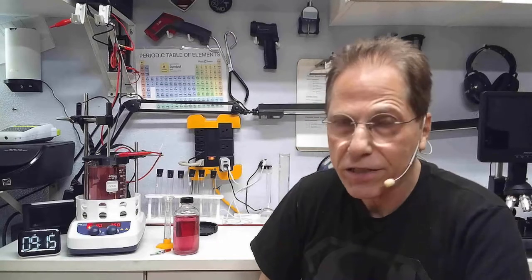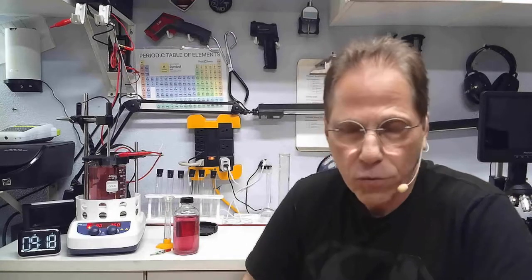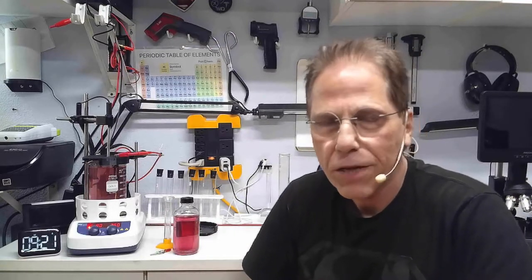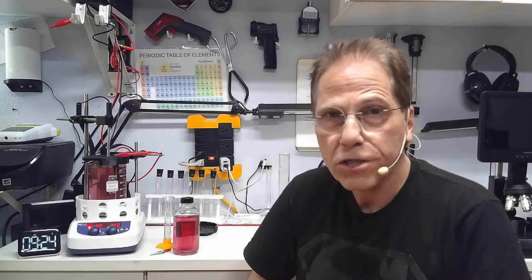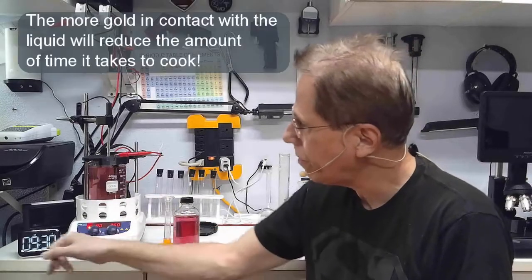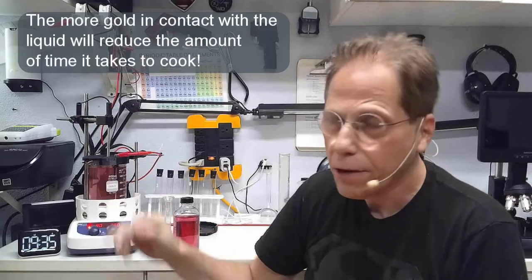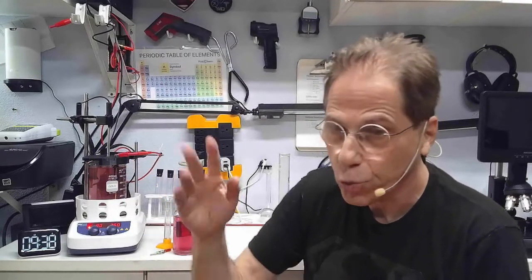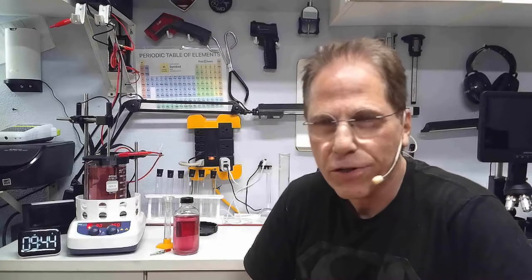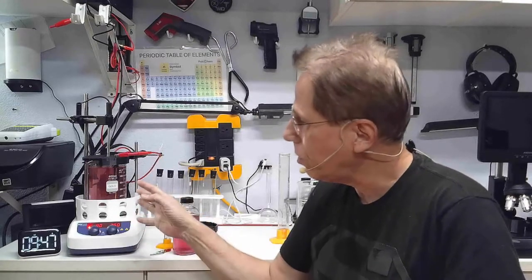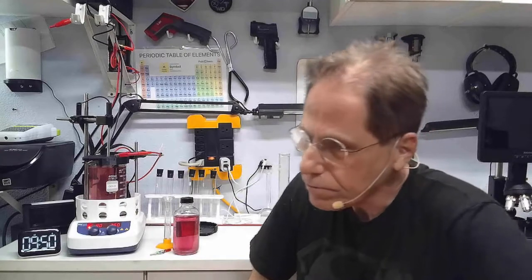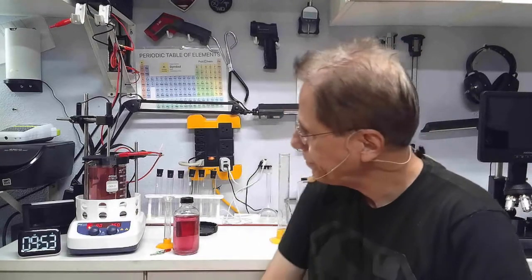If you're just using a solid piece of 22-gauge gold, just wipe it off, do your measurement, and you'll know where you stand. If you're using a 22-gauge or 24-gauge gold wire, it may take longer than 20 minutes. When I was making colloidal gold and I only had my first 22-gauge gold wire, I remember it taking about 34 to 35 minutes, so not a whole lot longer than 20 minutes. Keep that in mind as you're cooking your colloidal gold.